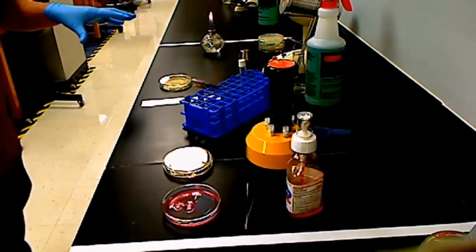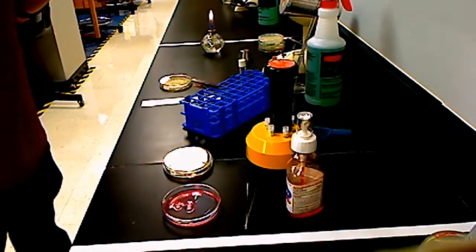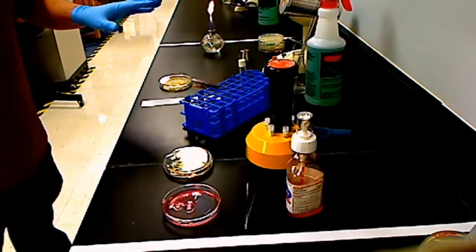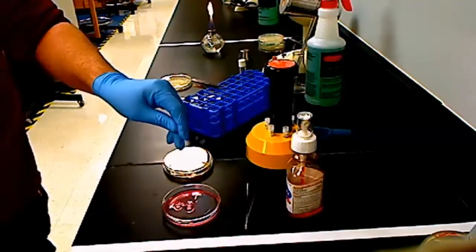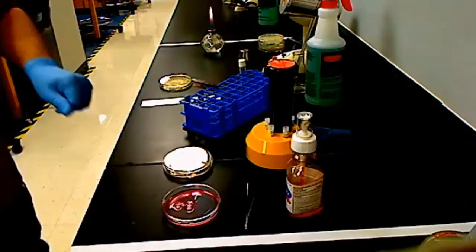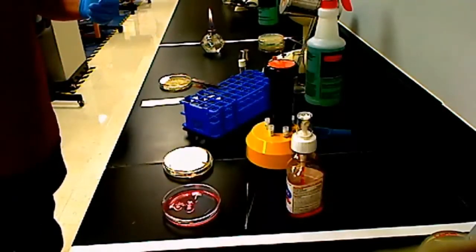What I've done over here is I've compressed everything down into one little area. You will be inoculating your plates at the actual stations. These other two things over on this side are an antibiotic dispenser and our actual active ingredient disinfectant, antiseptic. These two things will be in different areas of the classroom, and I'll show you those in a bit. But I've already disinfected this area, and first I'm going to inoculate my plates.